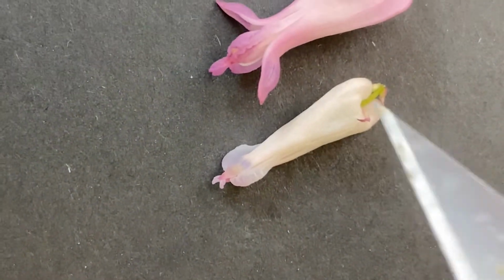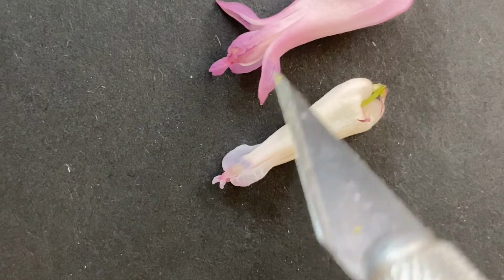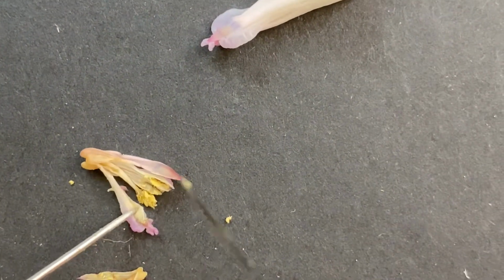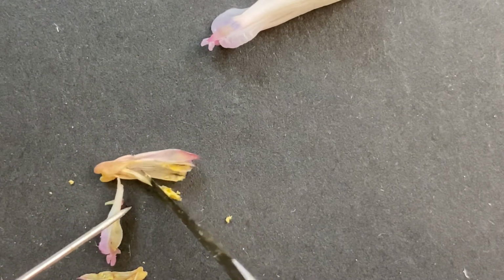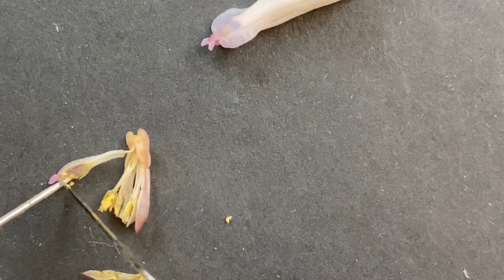When it's bigger, it's like this. So here's the corolla at the base. It's hanging down below the calyx, below these sepals right here. Then in the center, they really like to snug together. So here they are in this tiny little cavity, and you can see all that pollen right there.